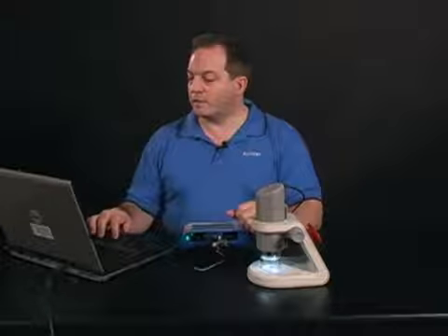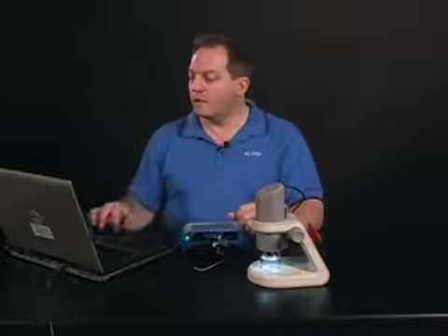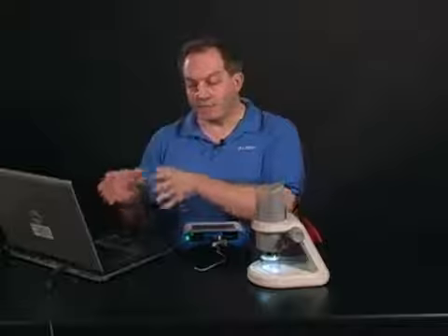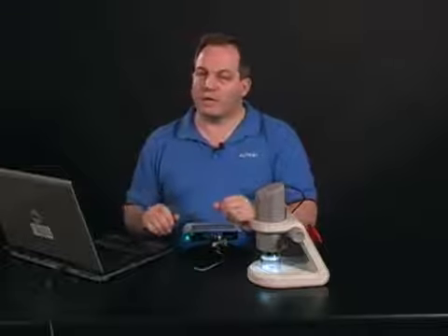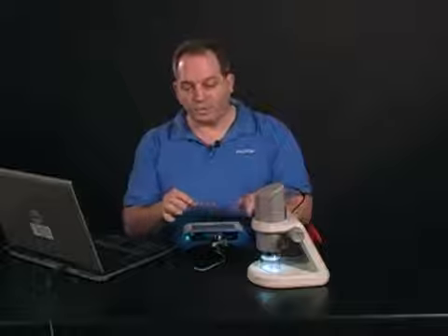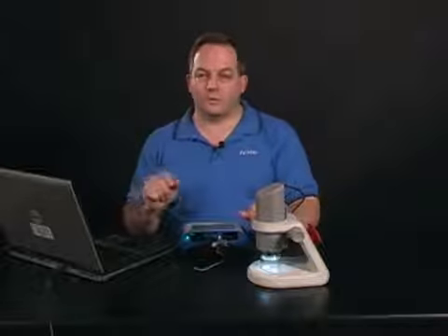So now I'm going to want to give that a more real-world measurement. To do that, I'm going to measure an object of known length. If I had an object of known length within the image, I would go ahead and use that. I happen to know that for this particular setup, on this 10x setting for 100 power, that 500 pixels is approximately equal to 1 millimeter.